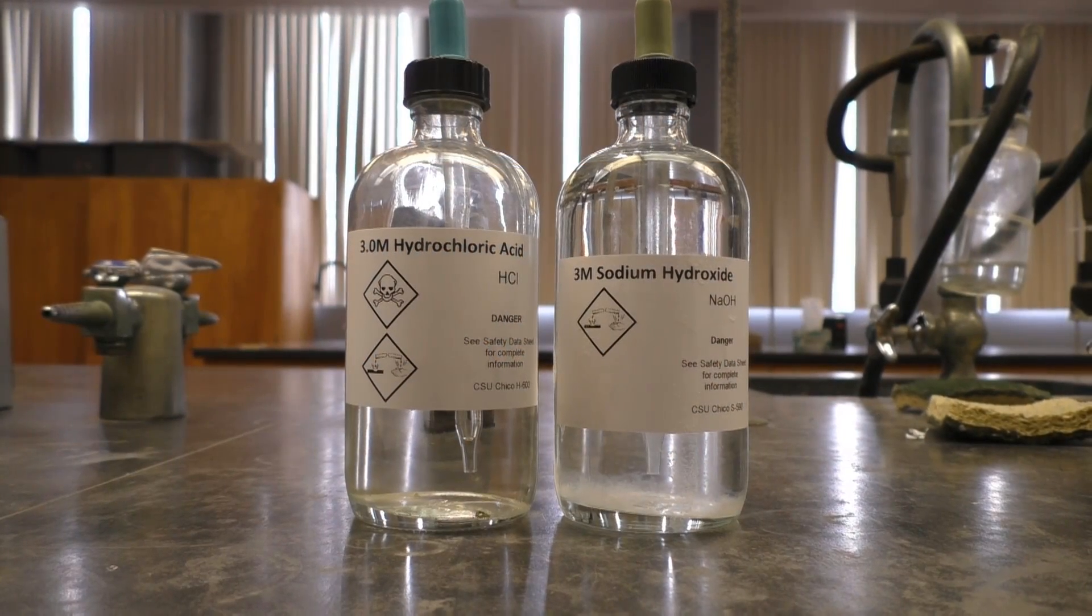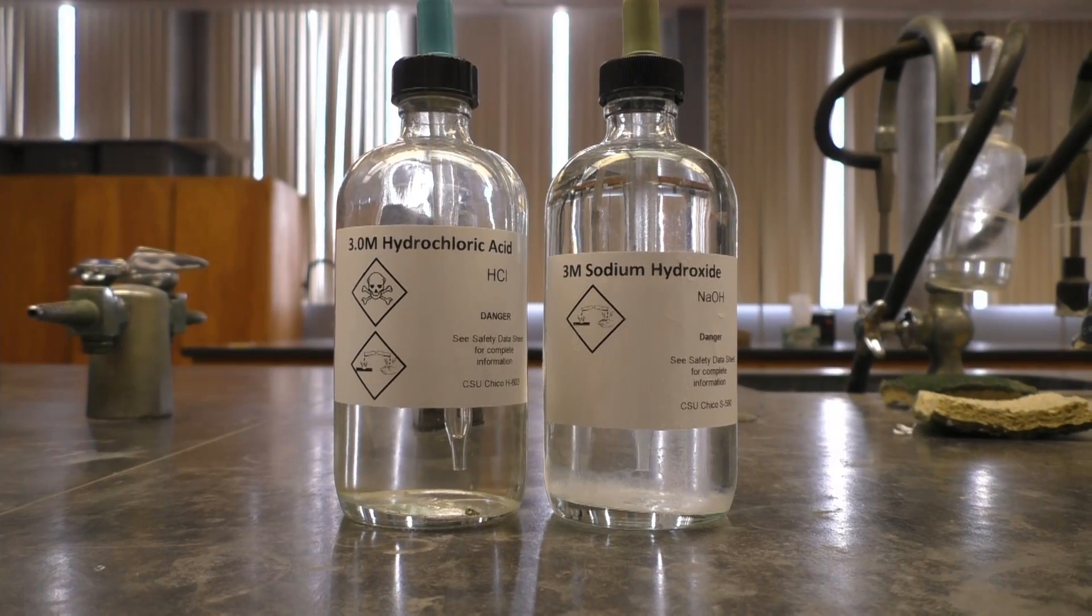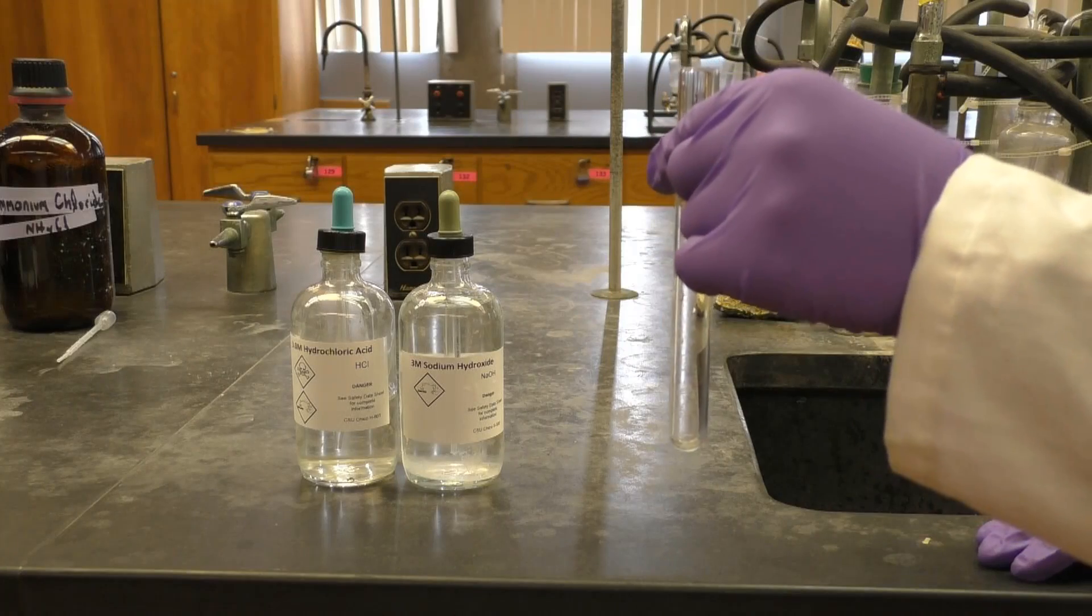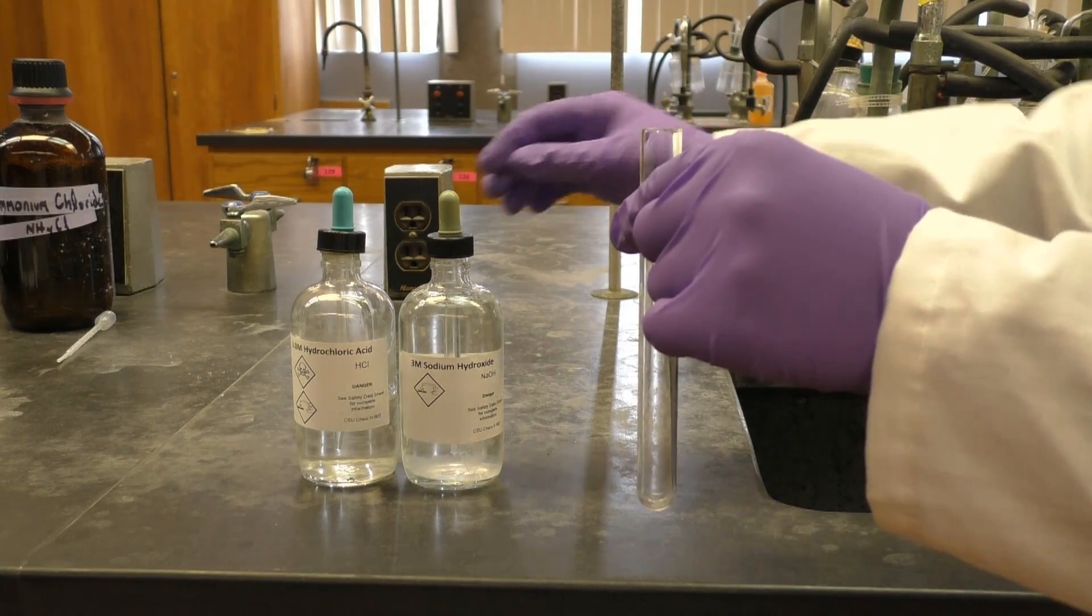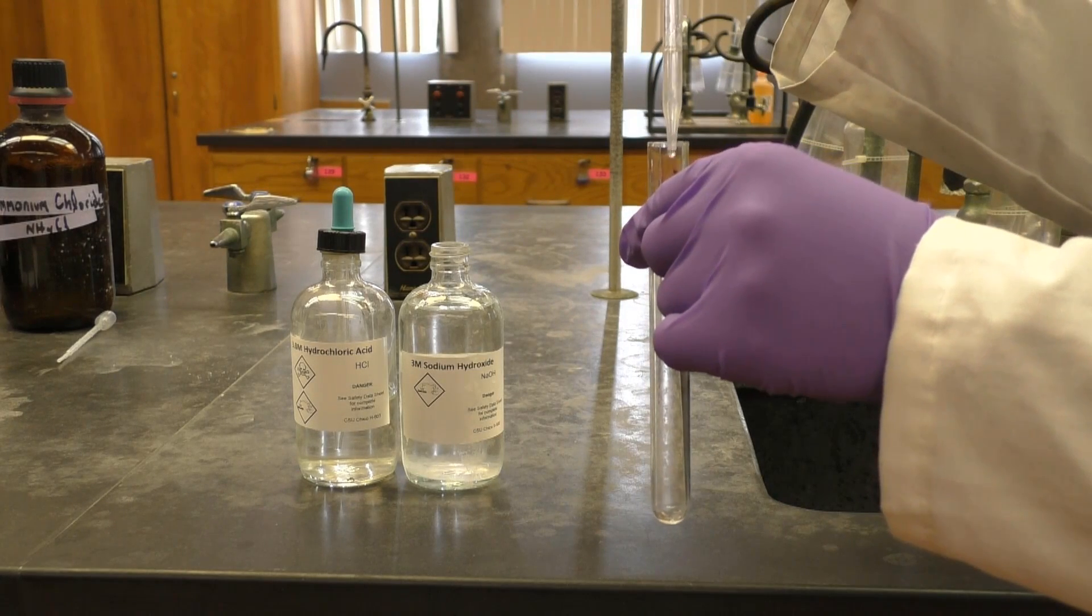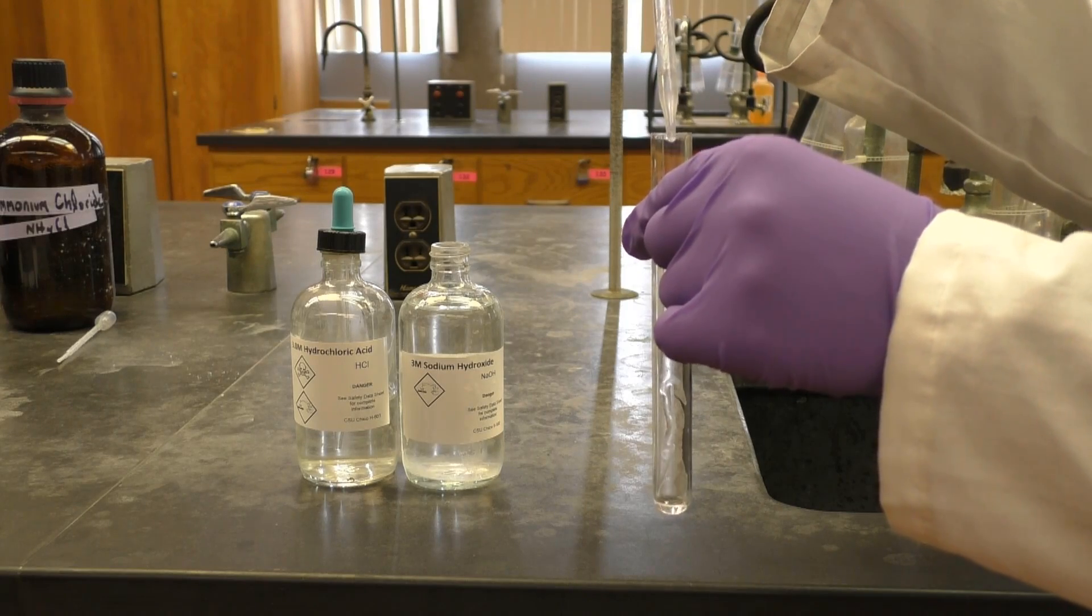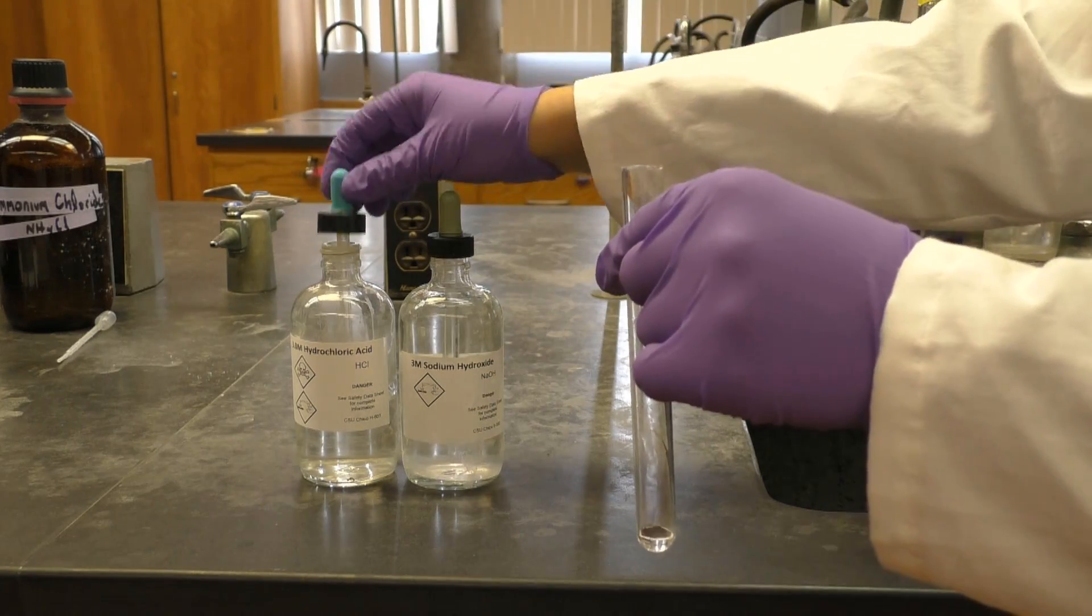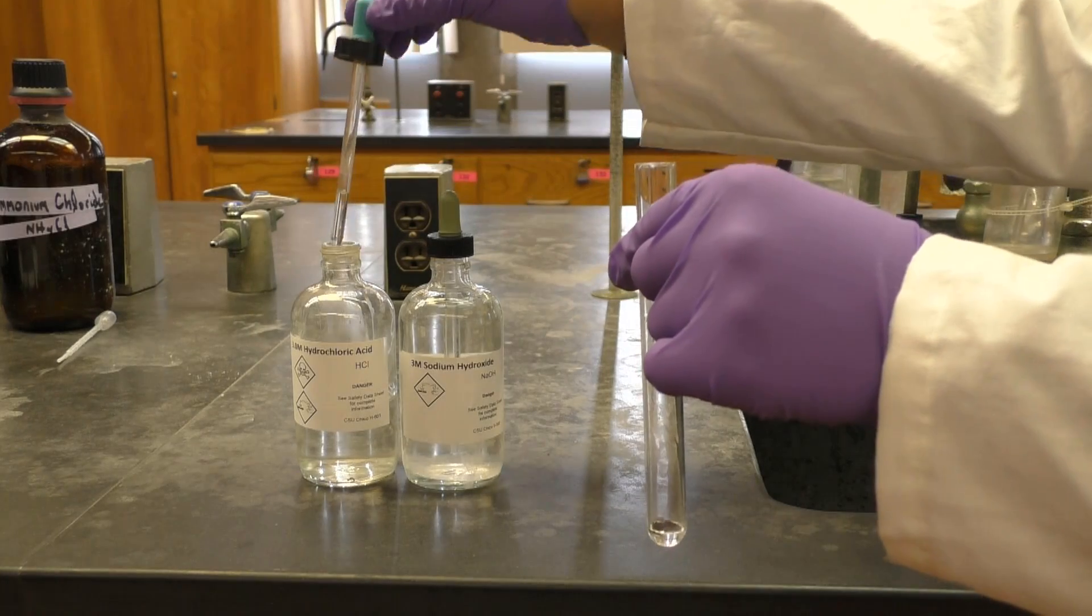First up, sodium hydroxide reacting with hydrochloric acid. All of your reactions today involve the same procedure: just add 15 drops of each reagent in a clean test tube and mix. It doesn't matter which reagent goes first. We promise you cannot mess up these reactions, so just relax and have fun.